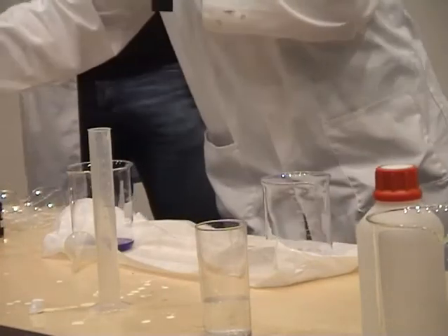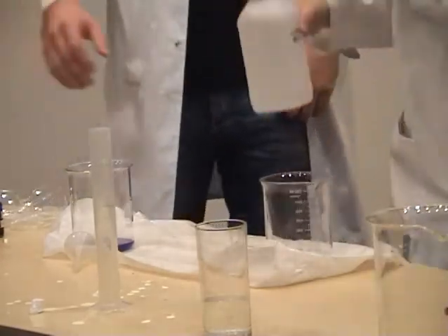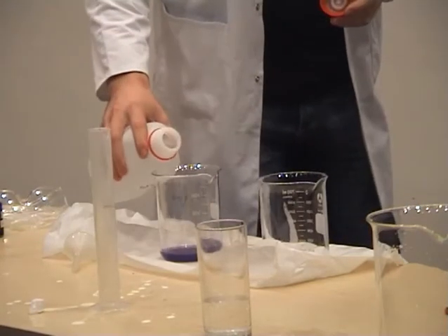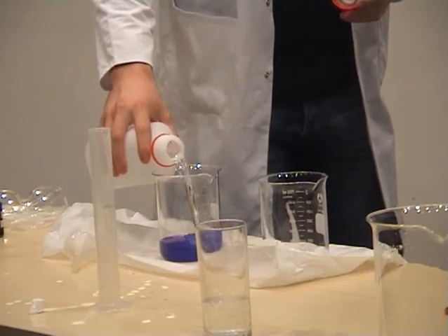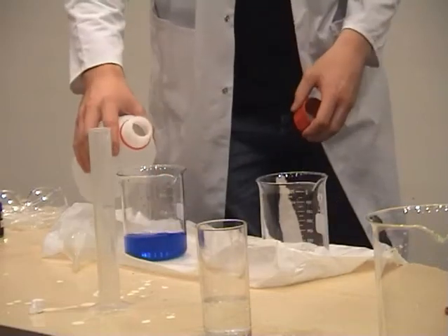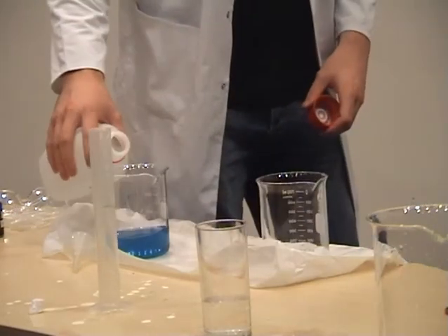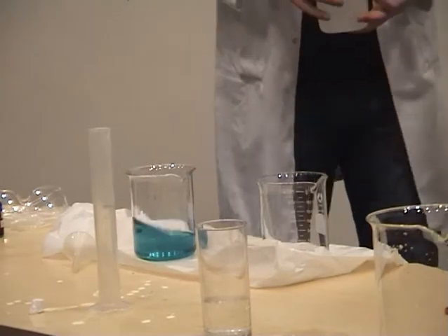Okay, so now, where's the acid gone? Daniel, I want you to add stuff in here until you get that to change colour. Just make it change. Don't go too far. Okay, we're getting it going. It's looking good. Let's see what will happen with a little bit more. Okay, nice and green.